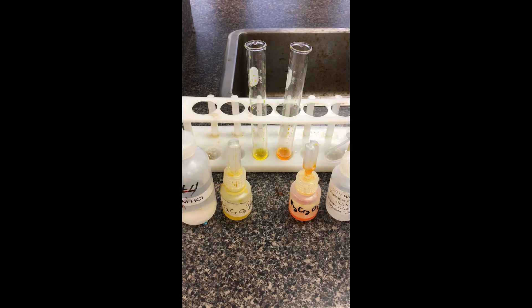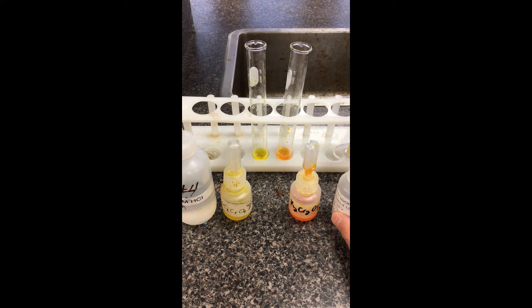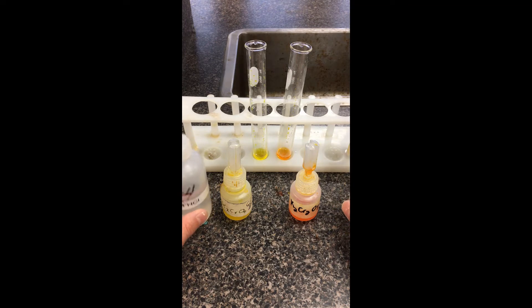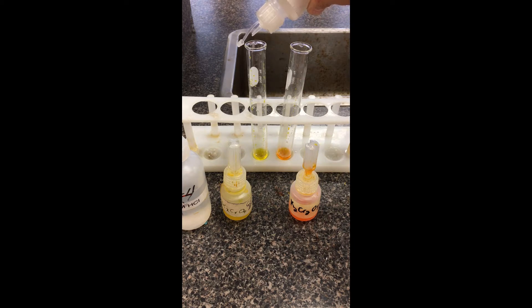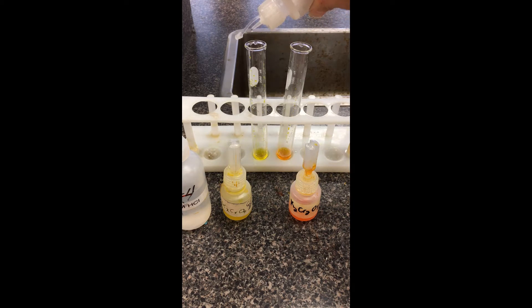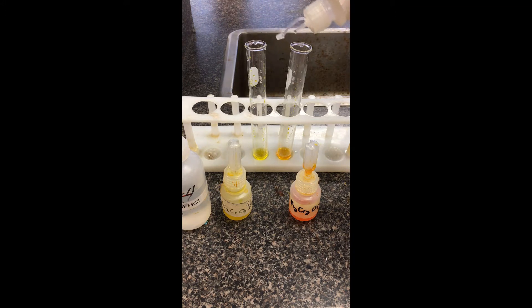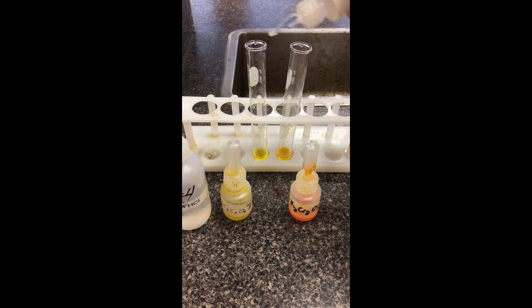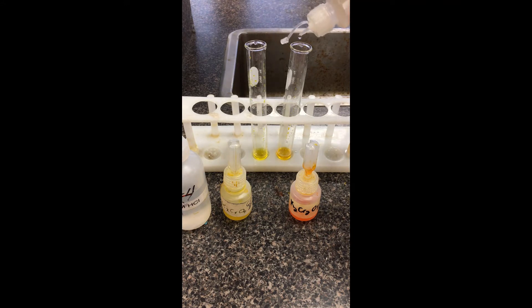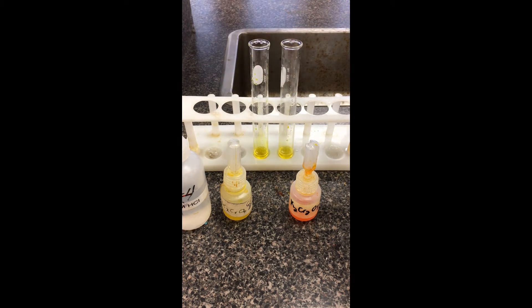Are there any changes as I drop them in here? I'm going to drop in base first and see if there are any changes to these test tubes, and then I'm going to add an acid to figure out what happens. So adding in the base here, one drop at a time, keeping it fair for both of them. Adding base and noting any color changes that might occur. Swirl around a little bit.